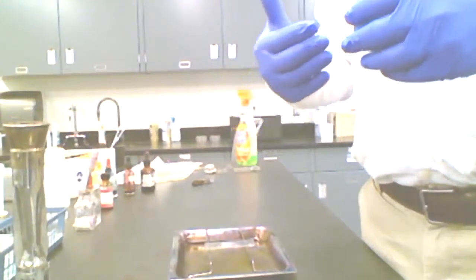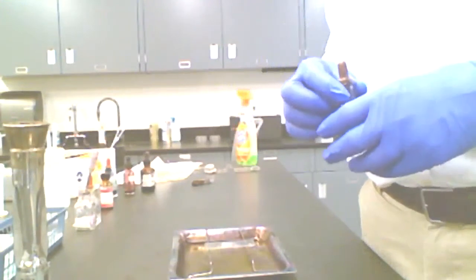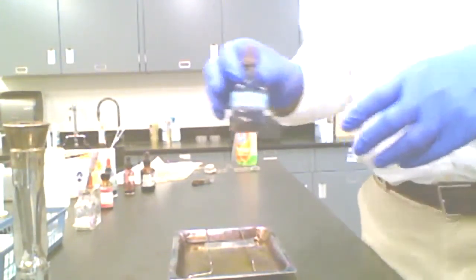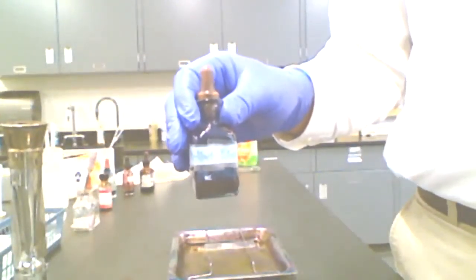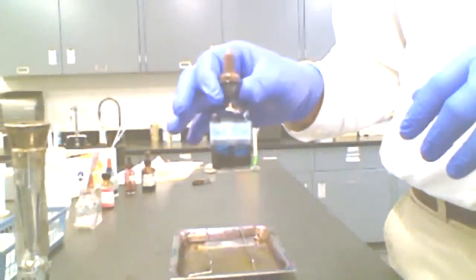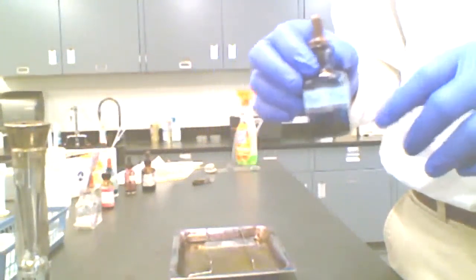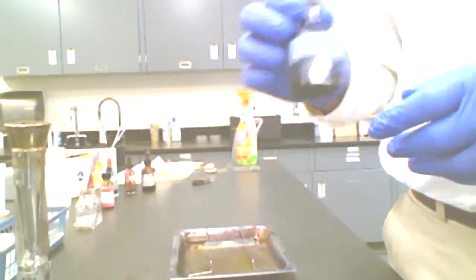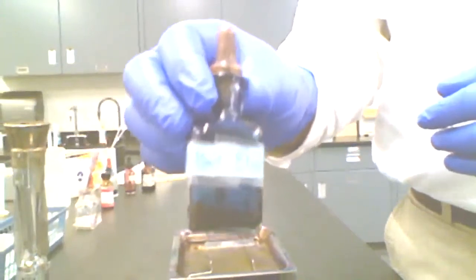I just want to be able to make these cells appear more fully, to get me some contrast between them and the background that I'm viewing them against. So my stain, and you can use any stain reagent you want for this. There are a number of them that stain cells directly. We'll talk about other simple stains where we're not staining the cells directly, but staining the background. That's for later. I'm using one that stains the cell directly, and this is called methylene blue.